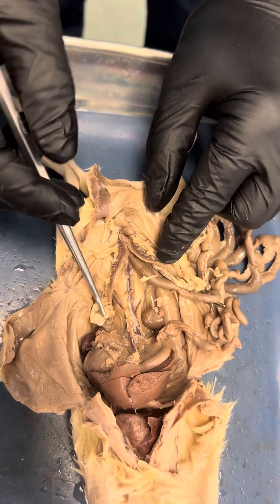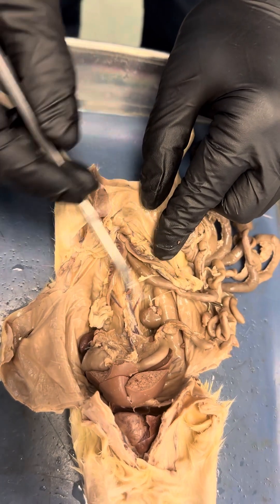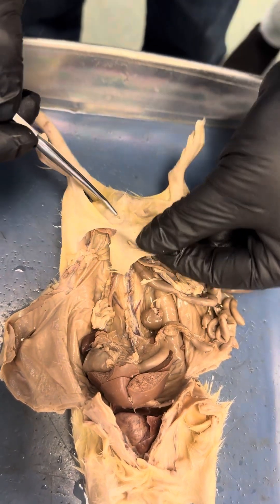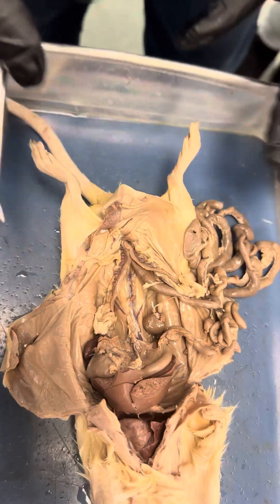And there are uterine horns with the ovary on both sides. This is the female — that's it, that's enough.